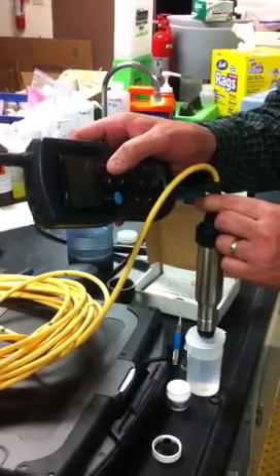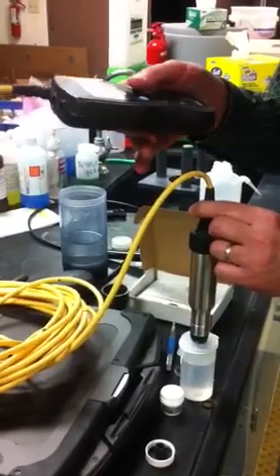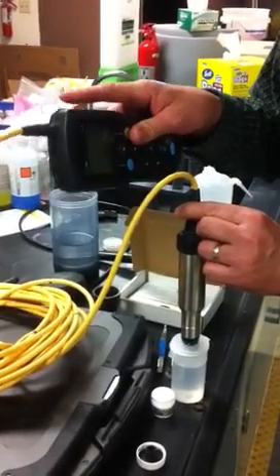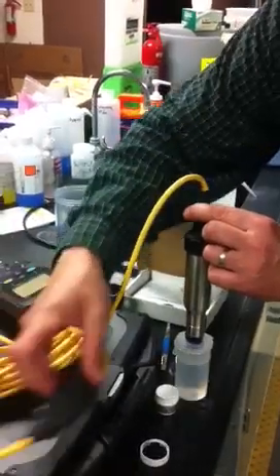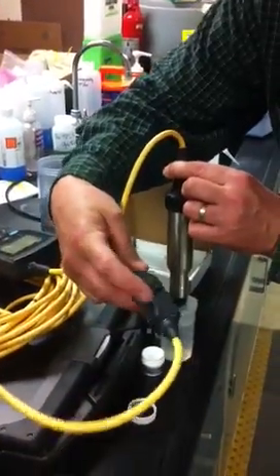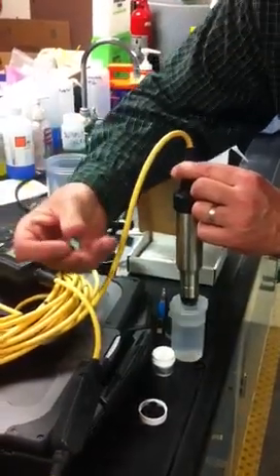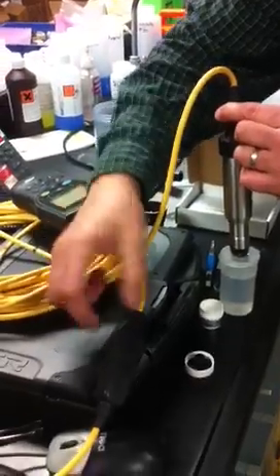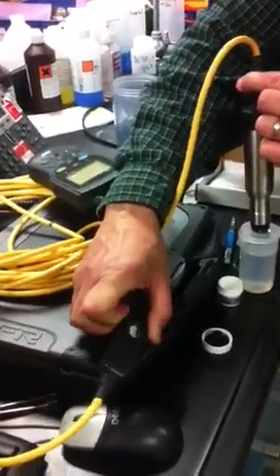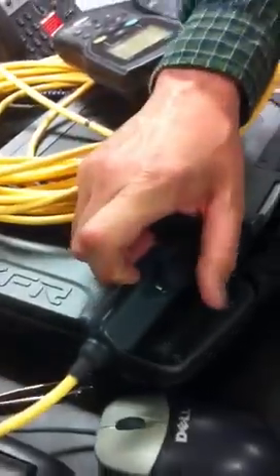And when that's done, all your calibration data is saved to the probe and cable, and then you can switch HQ40s at any time. And that's all there is to it. I guess the last step is to open this little container and put the new replacement battery in, and that resets your timer. This is the new battery that comes in the kit, and the new one goes in just like the old one, which is with the label up. Once you finish that, you're all finished and calibrated and ready to go. Call me if you have any questions.